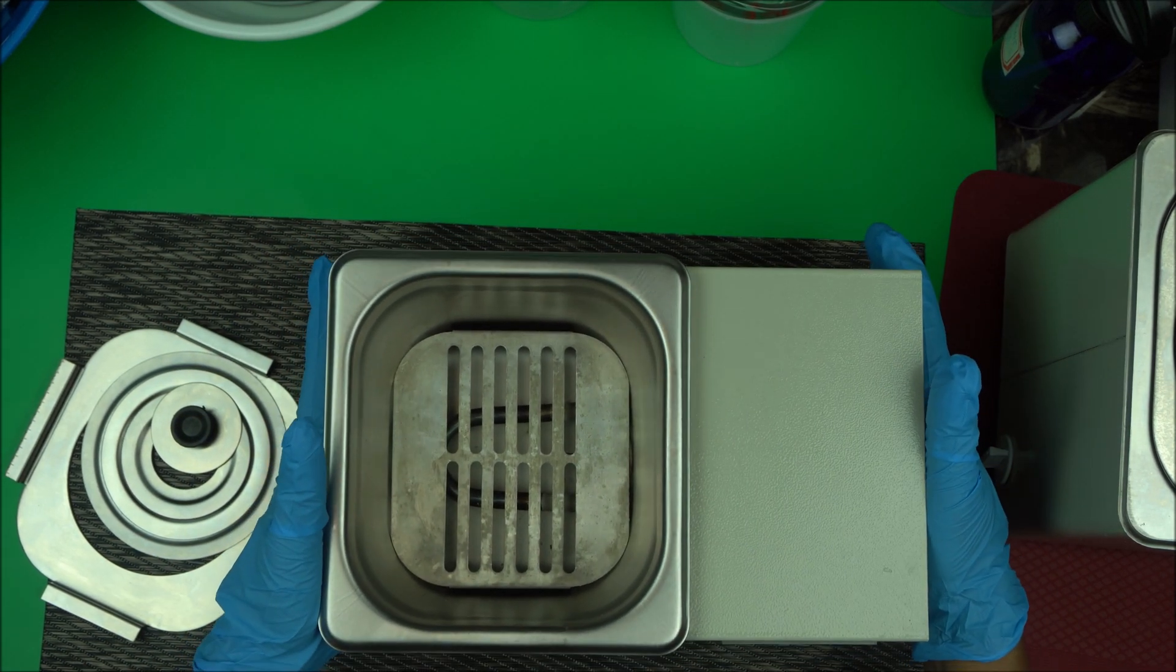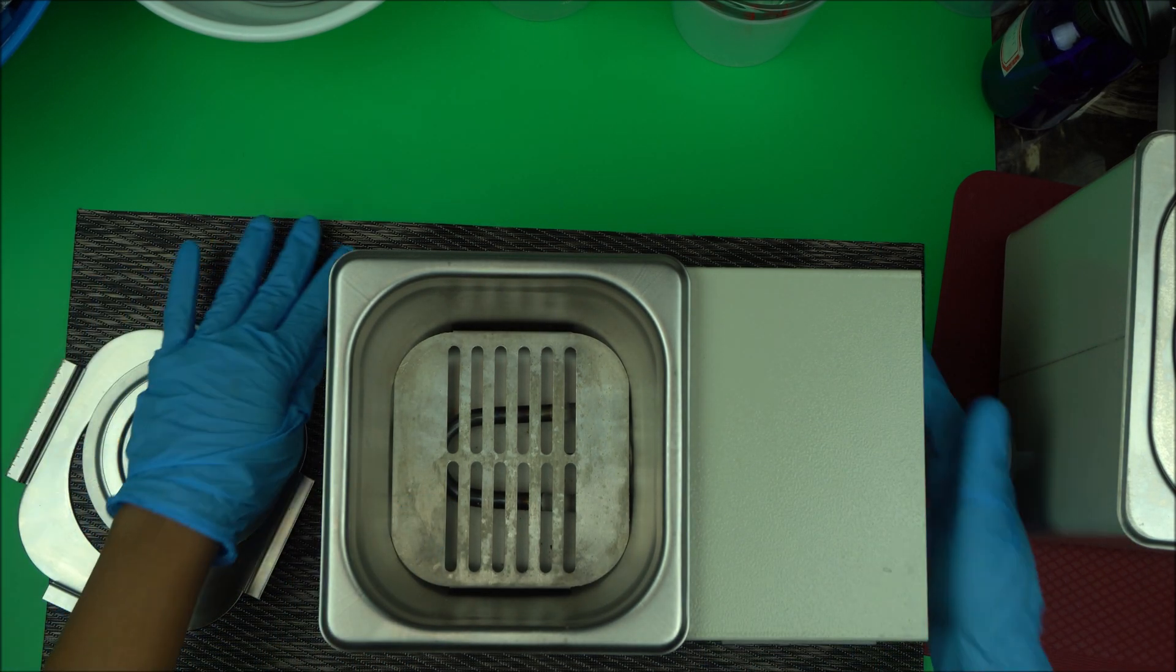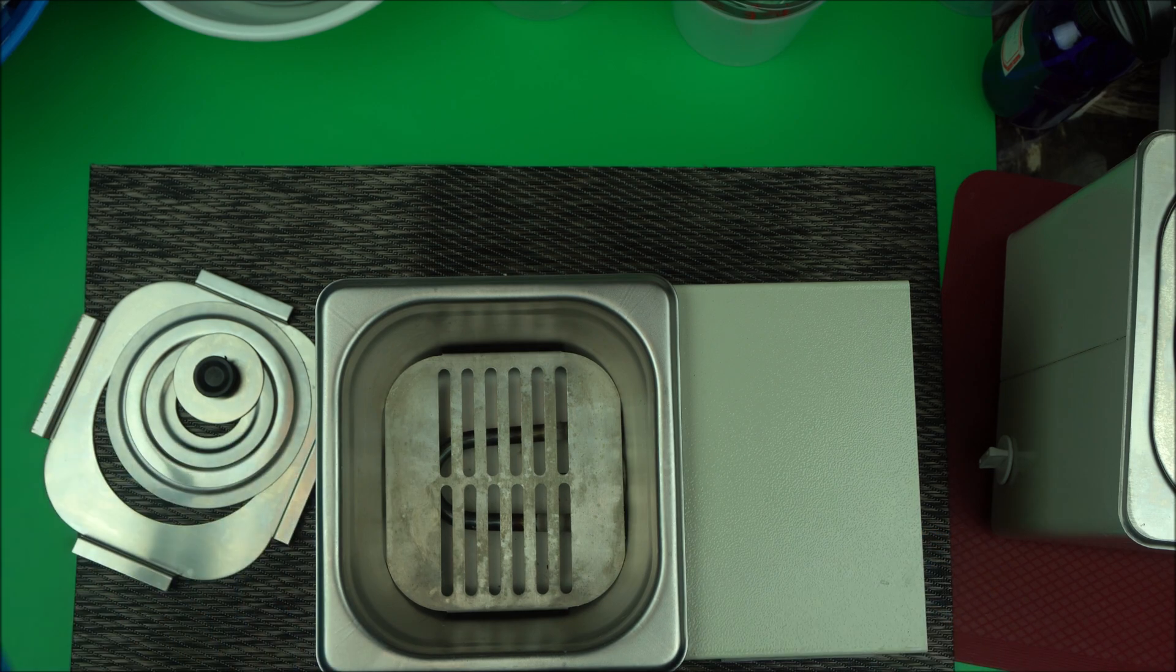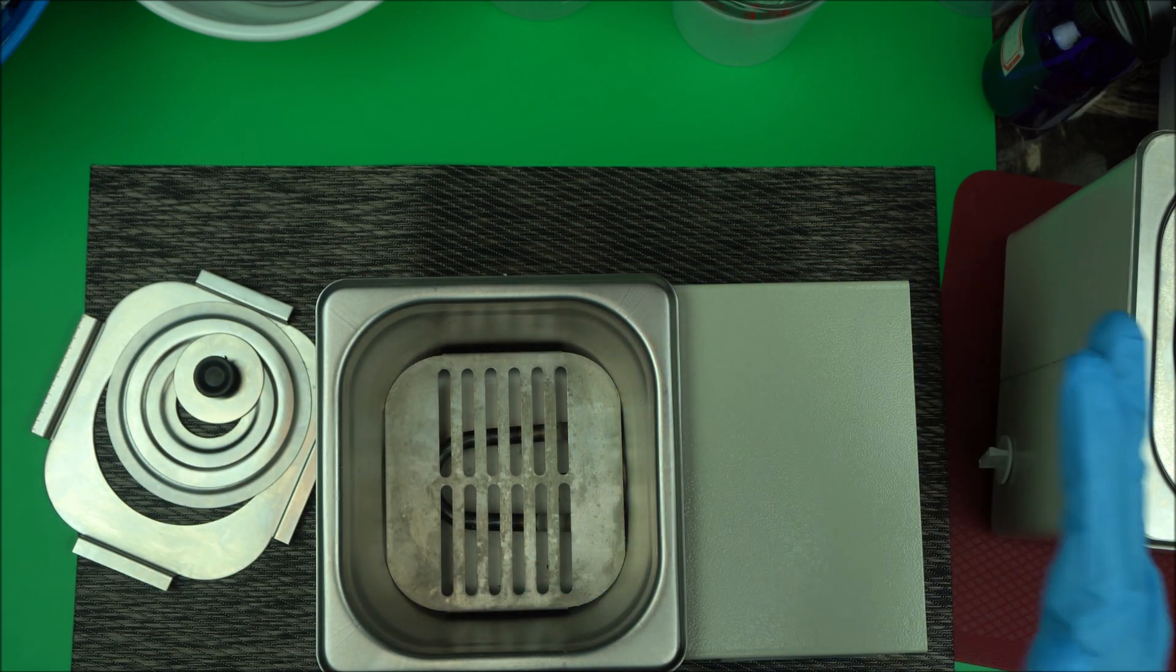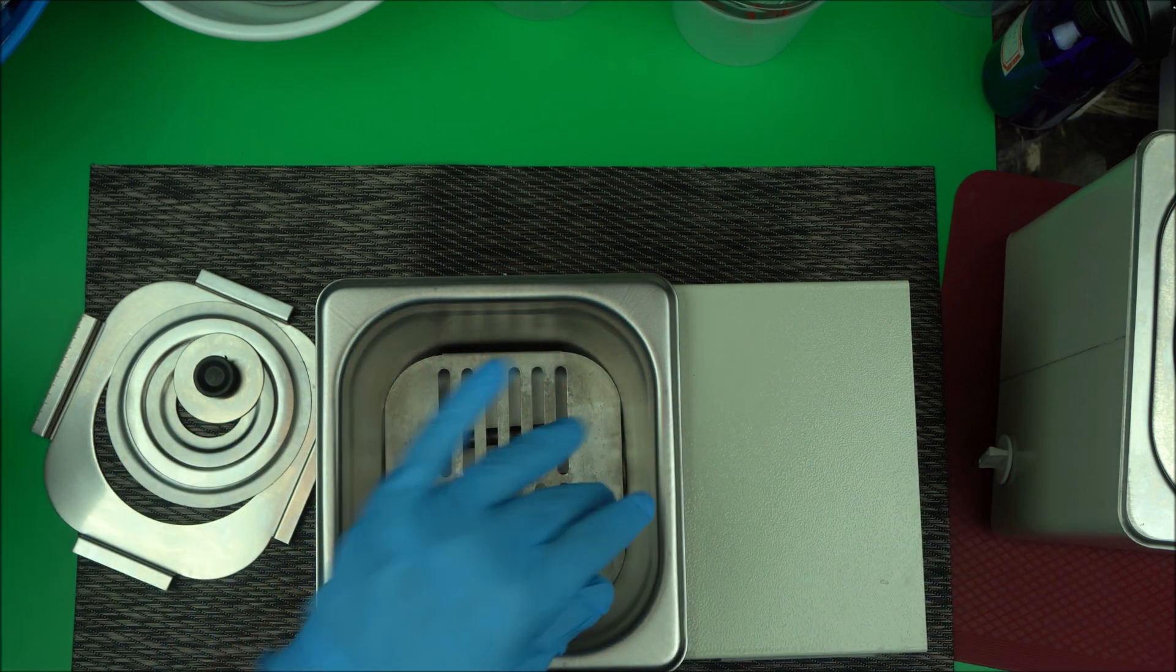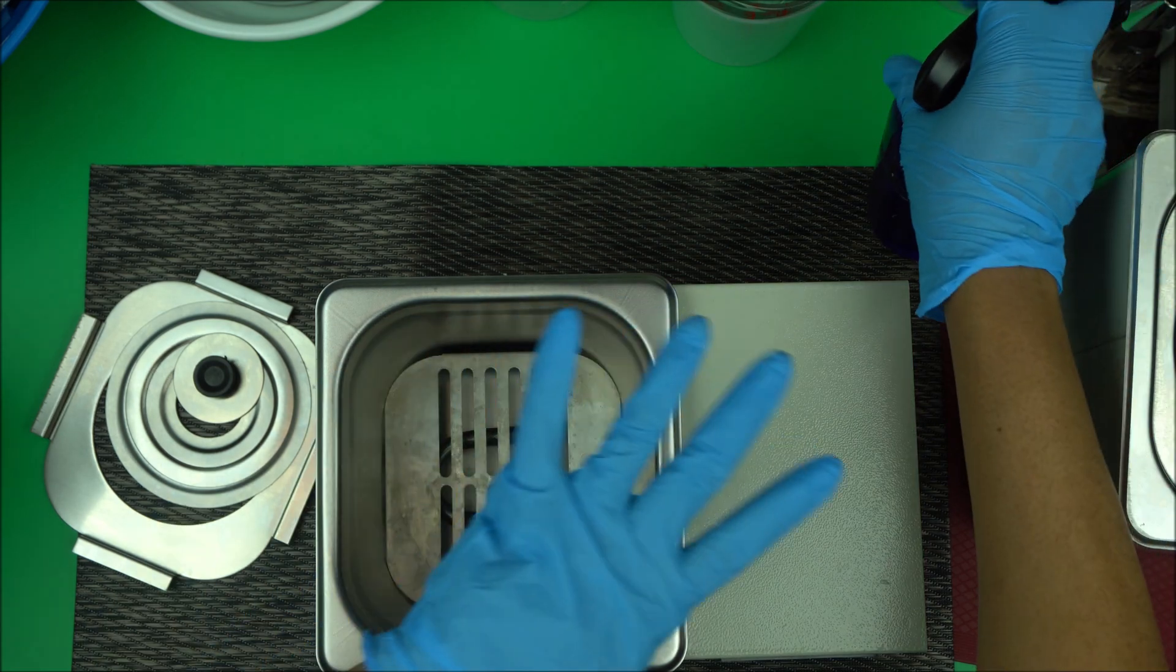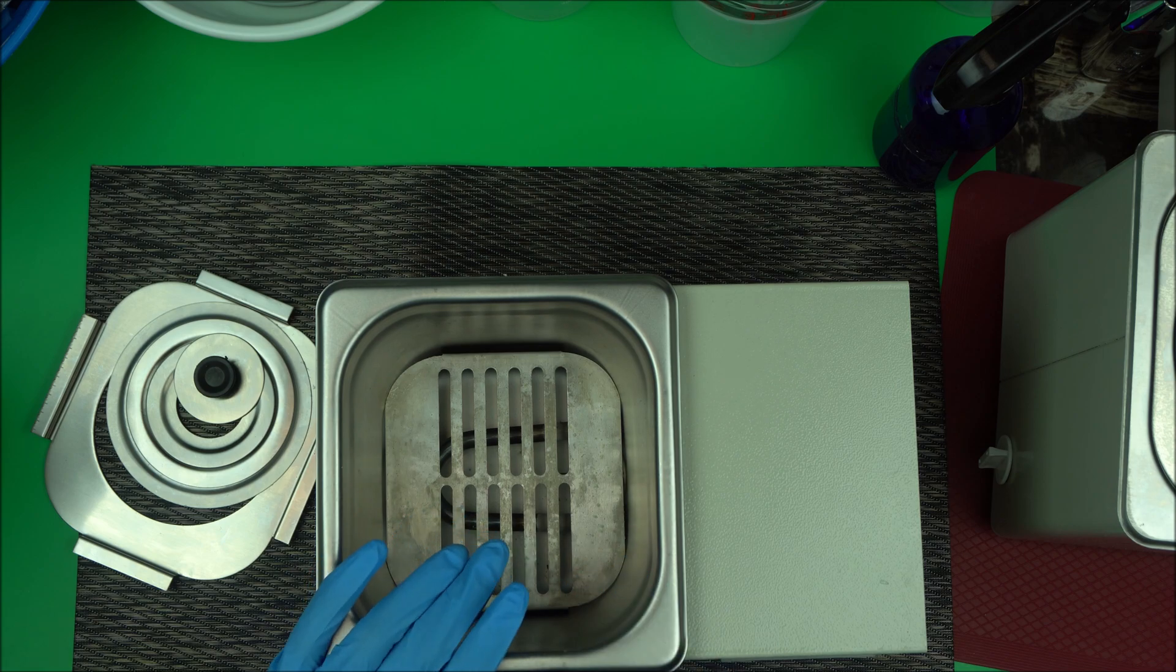Make sure your water bath is clean. Try to clean it occasionally to remove any impurities. It's very important when you are making formulations to remove contamination. You'll notice that it gets whitish stuff, and you can use rubbing alcohol to spray and clean it.